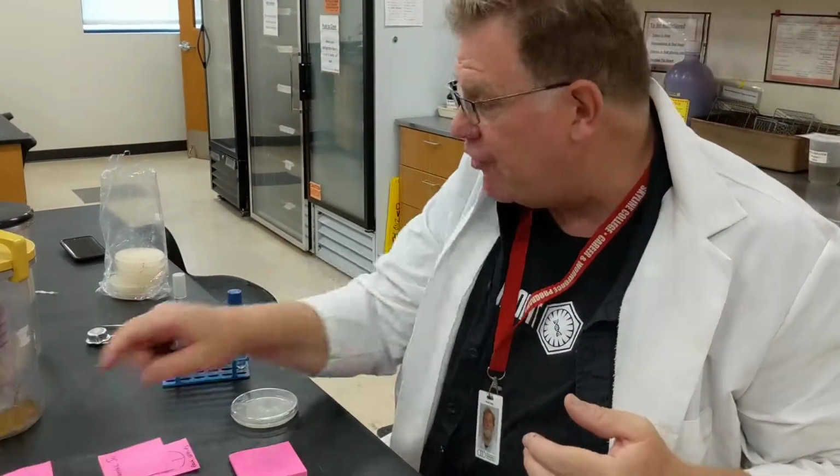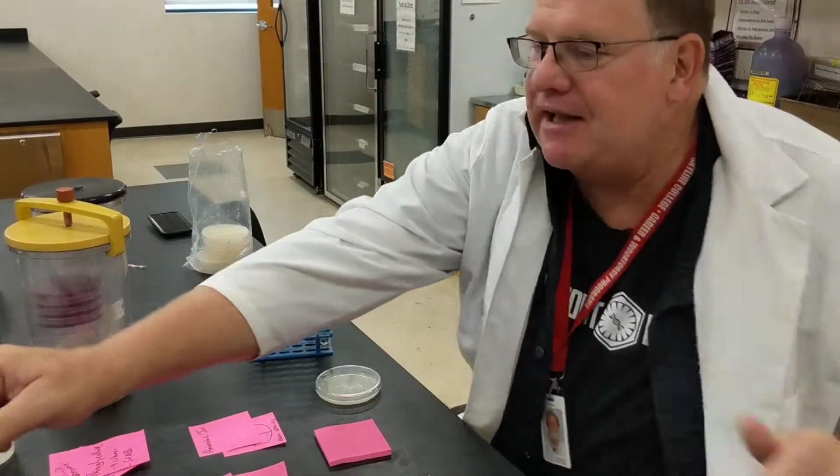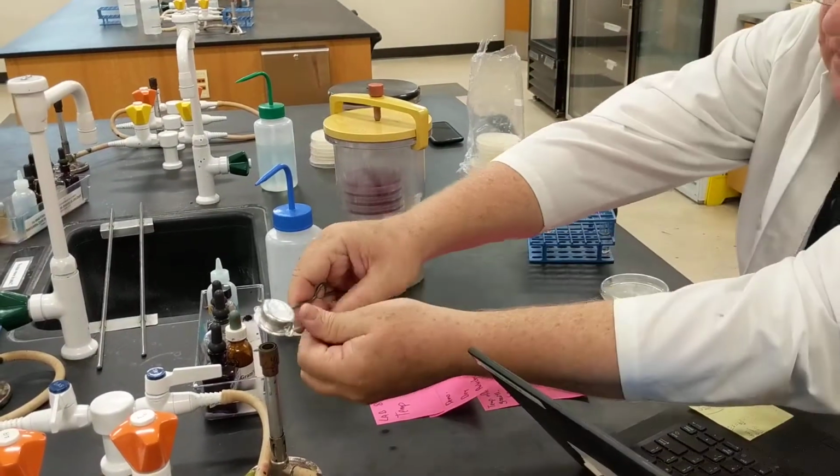You and your groups of 4 are going to inoculate 4 bacteria. So you'll need some flame. I'm going to get some flame going here.